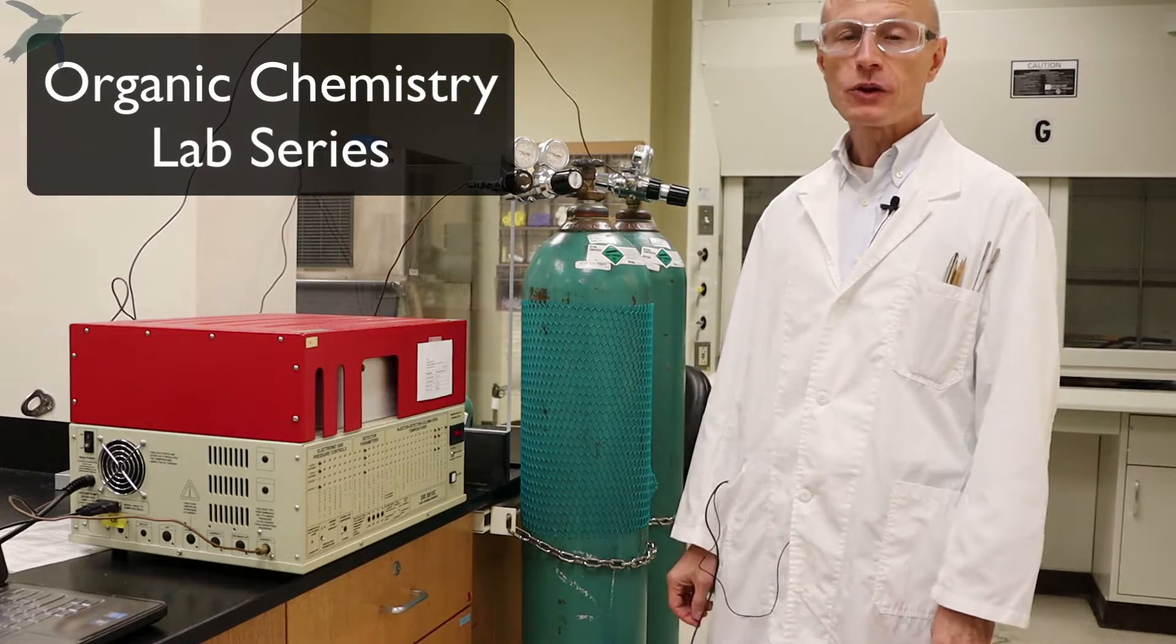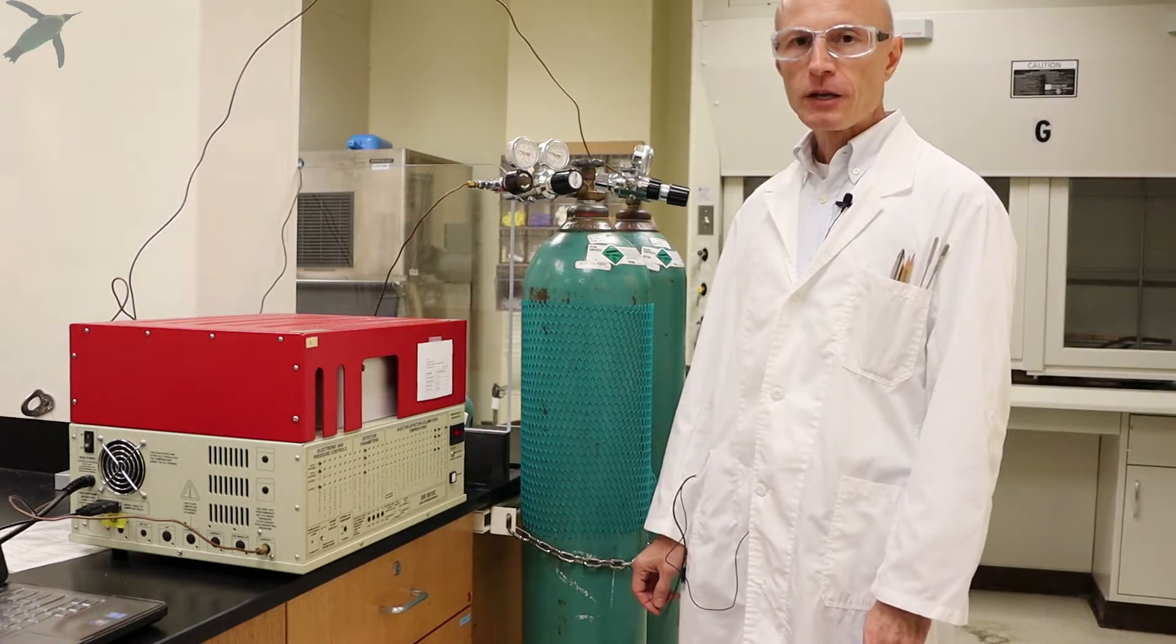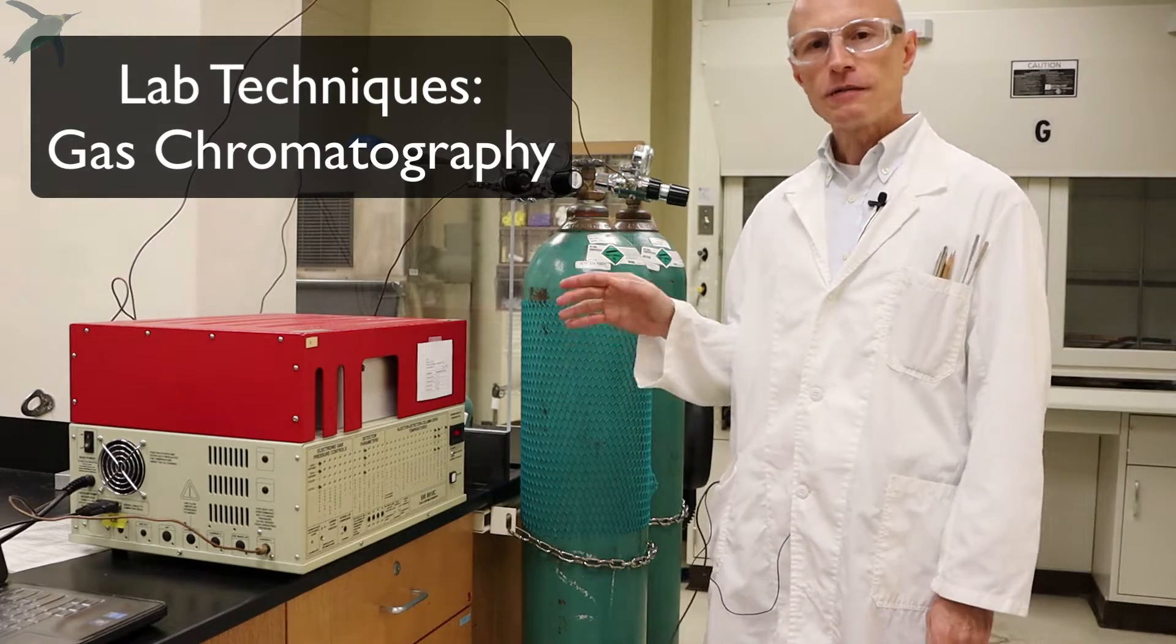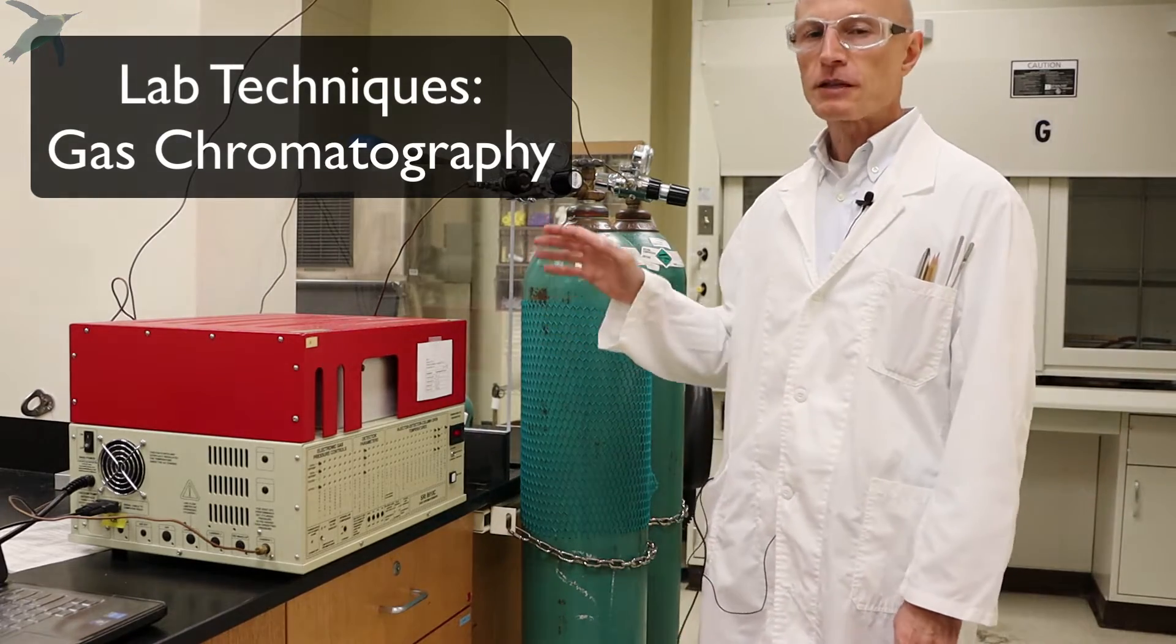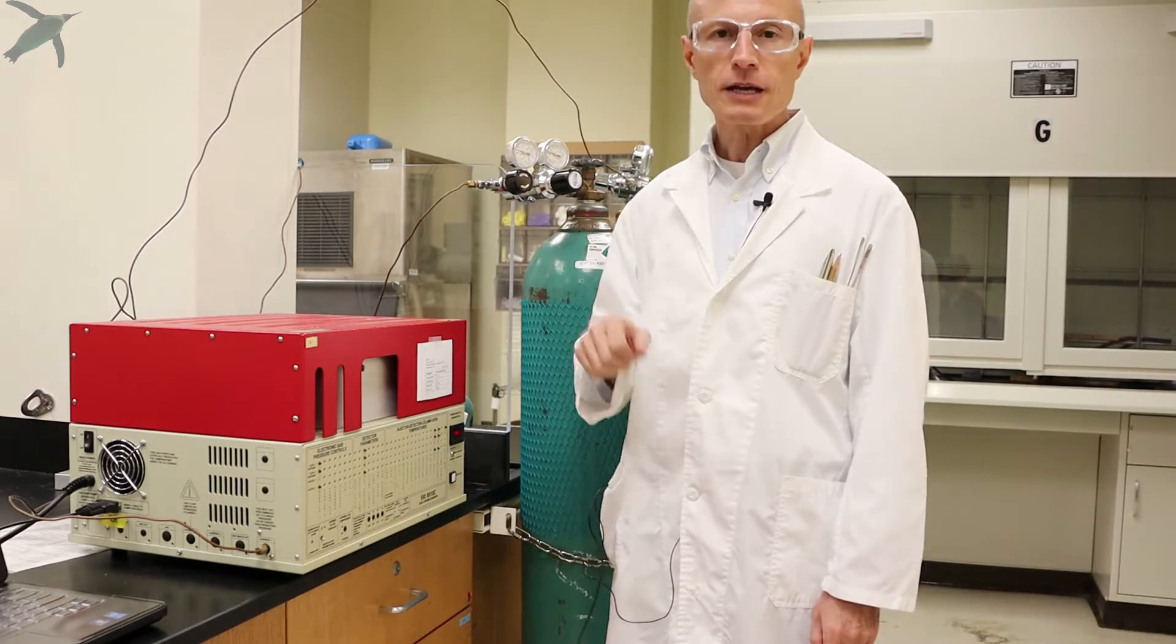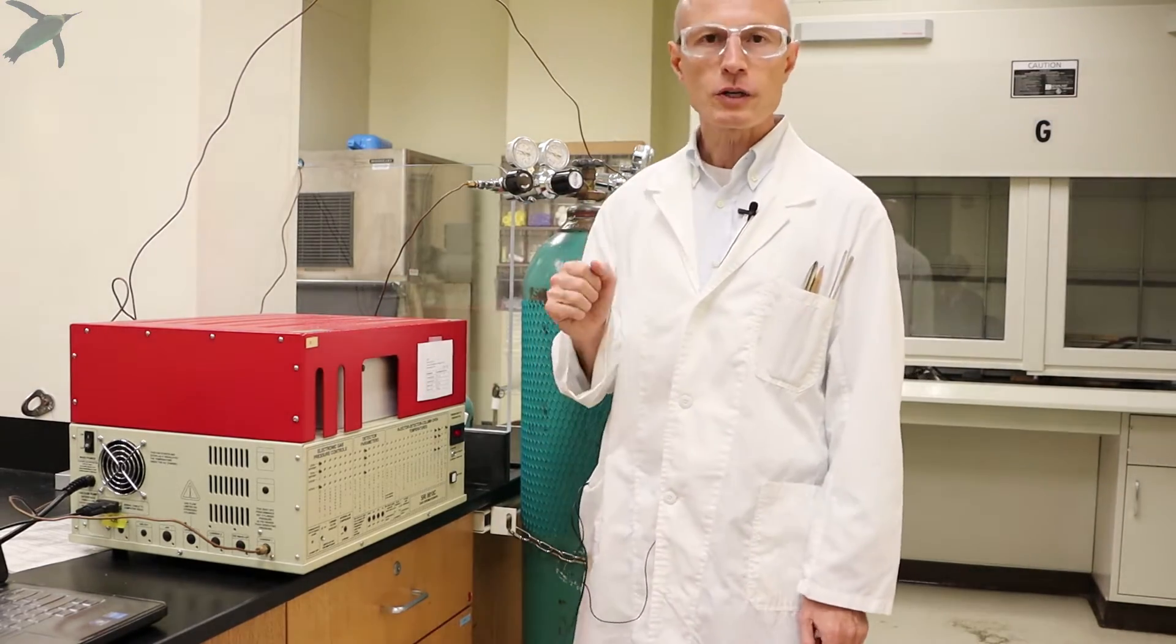Hello everybody and welcome to the organic chemistry lab series. Today we are talking about gas chromatography or GC for short. This video is about the practical aspects of how to use a gas chromatograph. The theory has already been explained in the corresponding video.